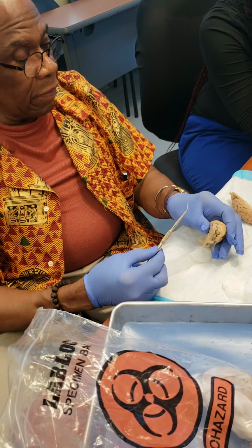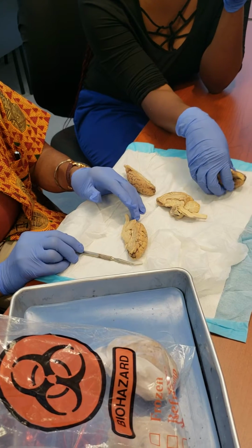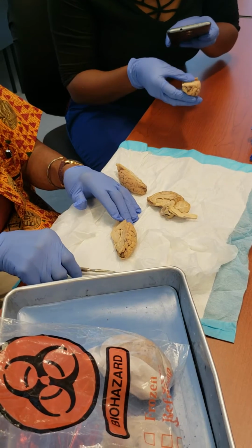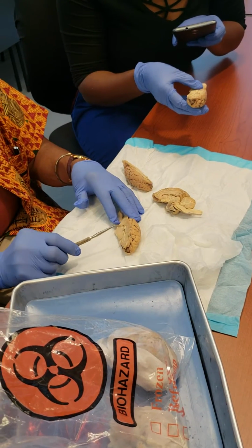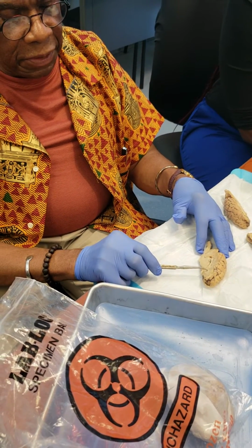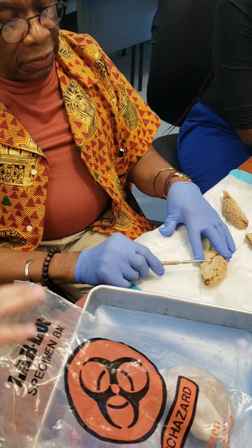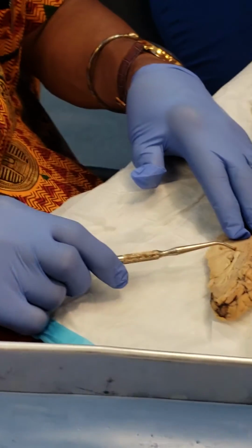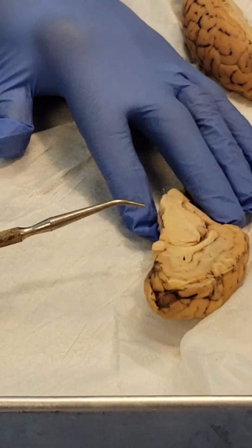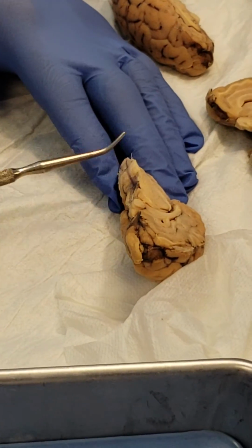Okay. Now, you need to go over this and learn it. Just take blunt probes out of the dissection kits, go over these, and recognize the lobes of the brain, gyri and sulci, the diencephalon with the corpus callosum and the fornix, the septum pellucidum, the lateral ventricle, third ventricle, cerebral aqueduct, fourth ventricle, pineal gland, midbrain, pons, and medulla.